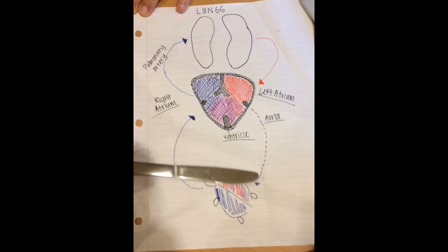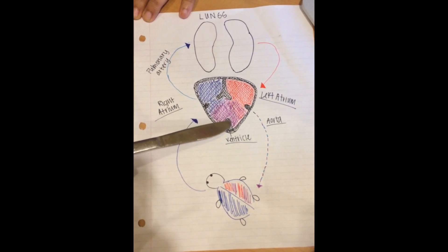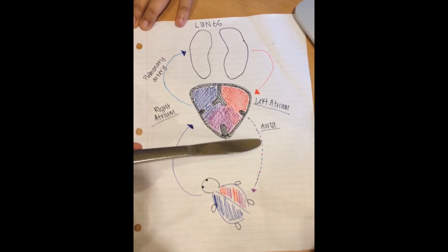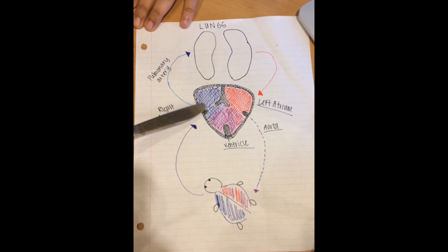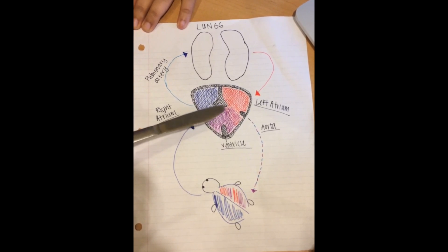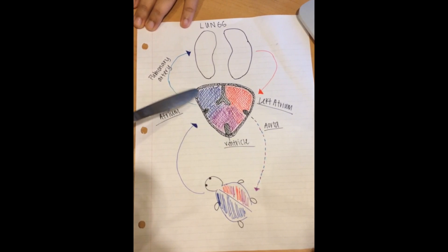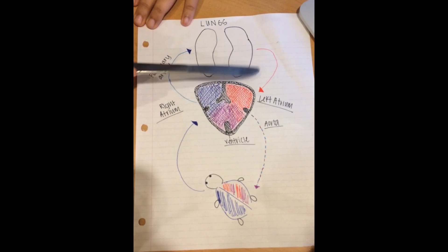Turtles have a closed two-loop system consisting of a pulmonary circulation which takes blood to the lungs, and a systemic circulation which takes blood to the tissues. The ventricle is partially separated by an incomplete septum. High-oxygen blood from the lungs enters the left atrium and is pumped out along with a mix of low-oxygen blood to the tissues through the aorta. Low-oxygen blood from the tissues enters the right atrium. A valve at the conus arteriosus separates further mixing — high-oxygen blood leaves through the aorta to the tissues, and low-oxygen blood leaves through the pulmonary artery to the lungs. When a turtle dives or goes into hibernation, blood can bypass the lungs by shunting away from the pulmonary arteries to conserve energy.